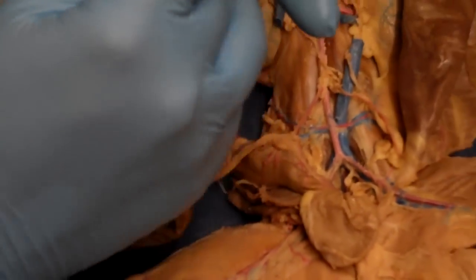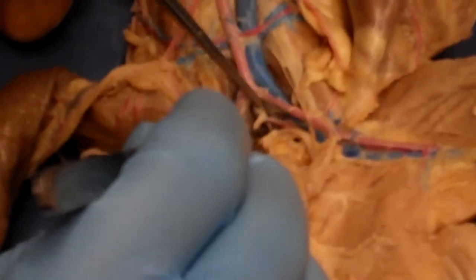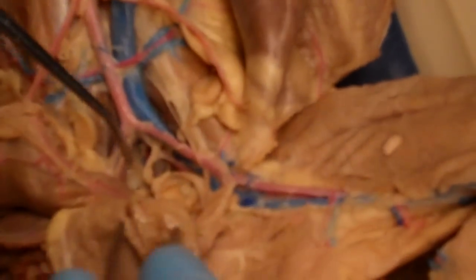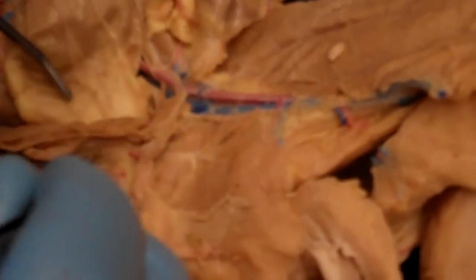If you dissect out a little deeper, what you're actually going to see, this one isn't great, but after the first big Y, there's a second smaller Y sort of in the fork of our big Y. So we have the external iliacs. The second smaller Y is going to be the internal iliac arteries, and there's one right here. Again, they're going to be paired. There's a left and right internal iliac artery, and they're going to do portions of the bladder and the last little portions of the rectum and a lot of the organs that are found in the pelvic cavity.